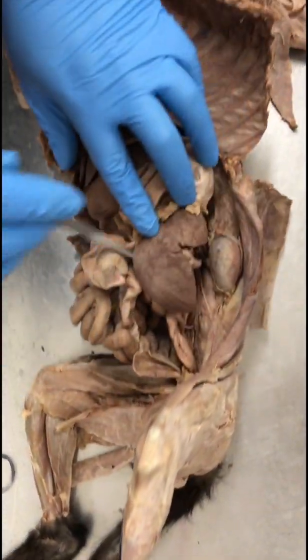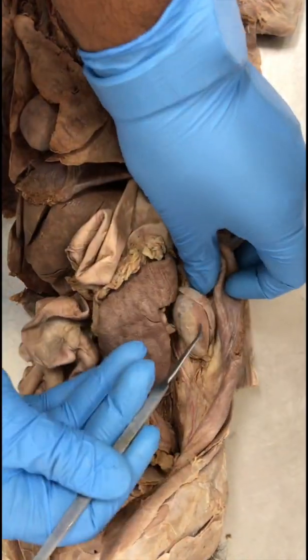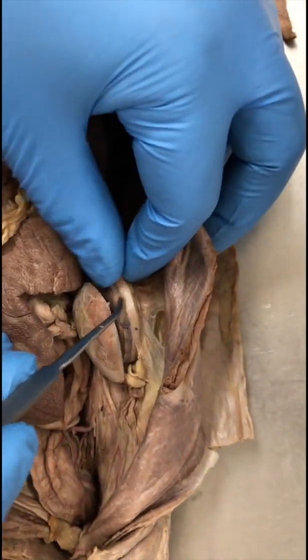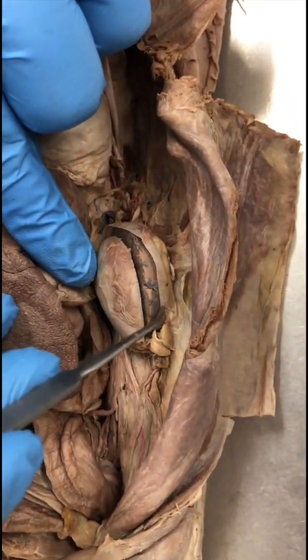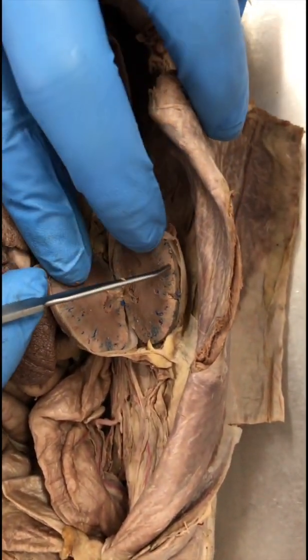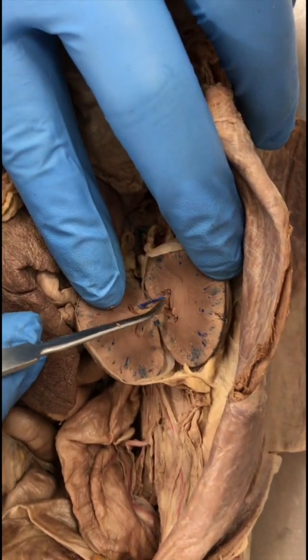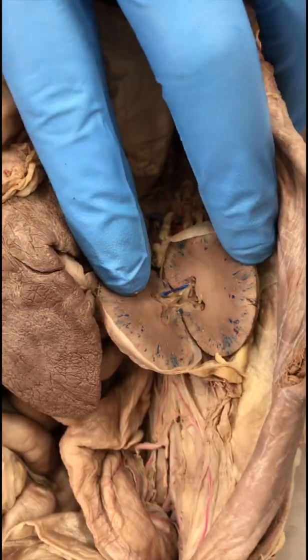Spleen. Okay, so this is the spleen. Kidney. Okay, kidneys are right here. This outer layer is called the renal capsule. Okay, this outer membrane that we have taken off. This is the renal capsule. Okay, then you make a cross section. This light colored part is the renal cortex. The inside part is the renal medulla, and this is the renal papilla. The small ridge here is the renal papilla.